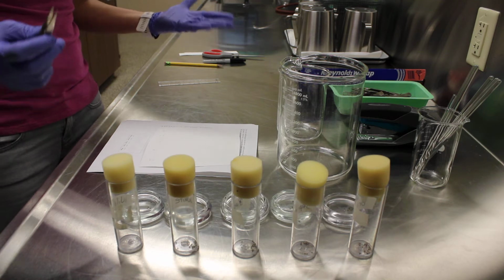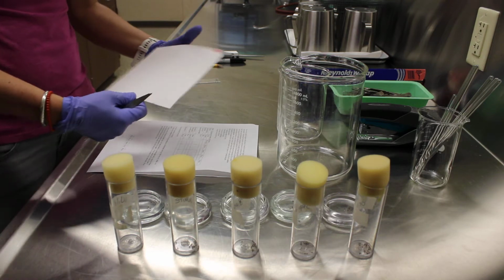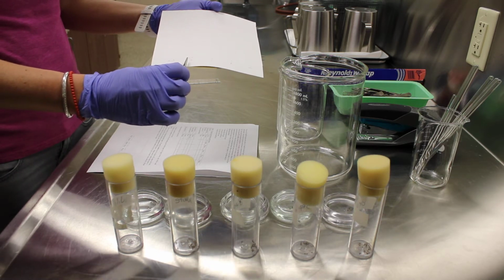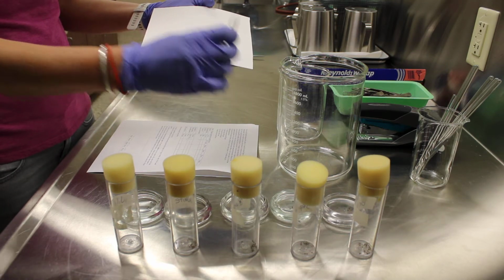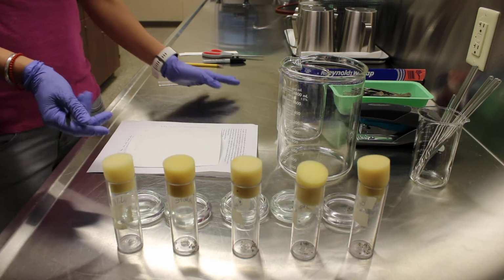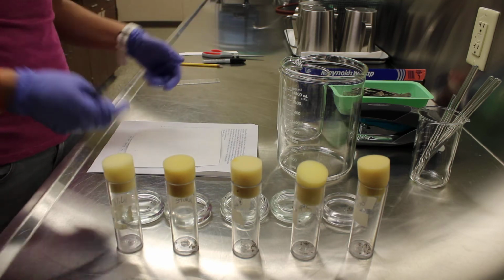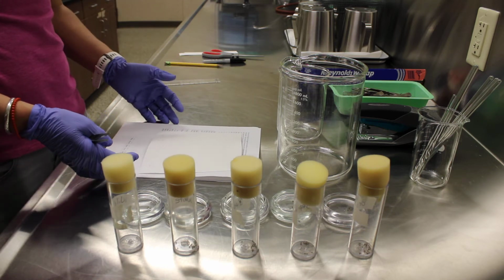So I have a piece of chromatography paper set up here, and I've got a couple of tick marks. This one's labeled wild. This one has a B for brown. This one has an S for sepia. This one has an R for rosy, WH for white. So those are all different phenotypes of fruit flies. The wild type fly makes all the pigments, so that's the typical type fly. The brown, the sepia, the rosy, and the white are all mutants.